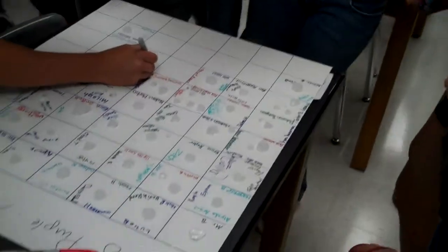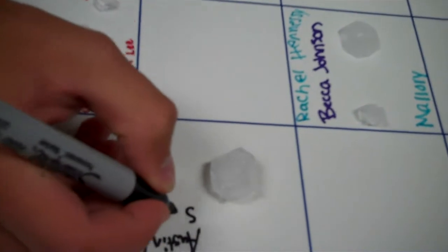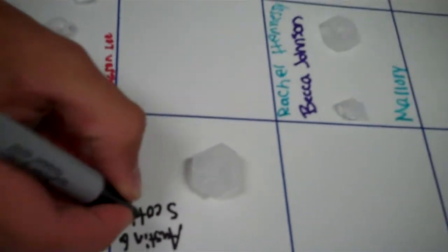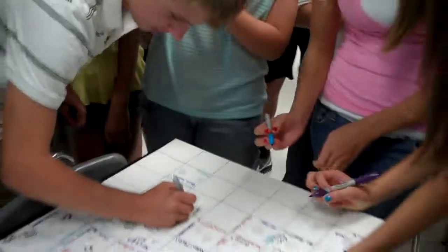Okay, so here we are. Our results for the Crystal Lab. We've had a lot of success here. We're going to have a Dixie cup that's sitting here on the bottom. Good work. Where is he? There he is.